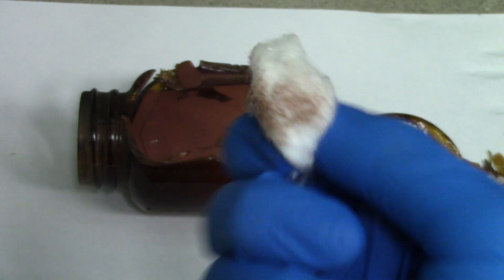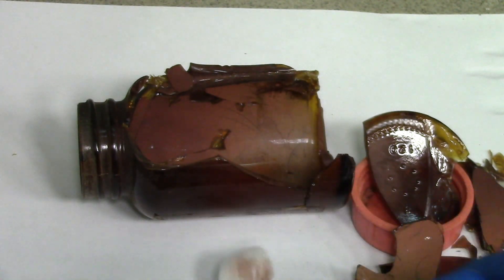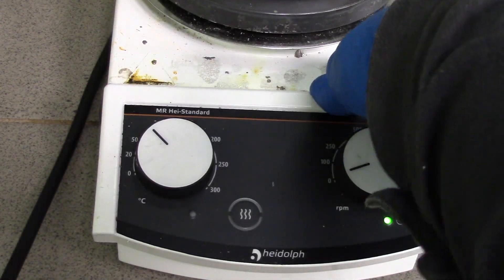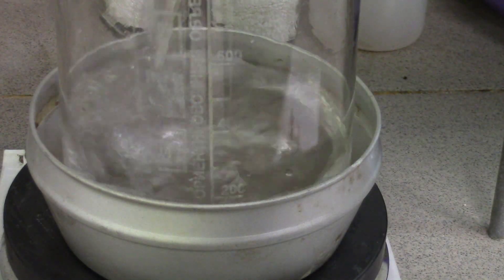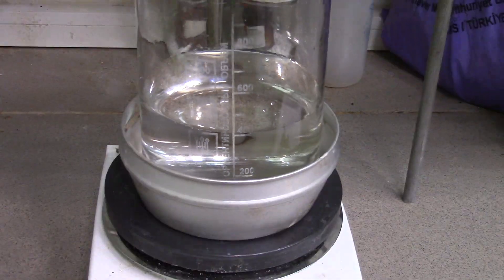In my case I need to wash it off from pieces of broken glass container. For doing this I put a huge beaker onto a hot sand bath for even heating, then poured 400 milliliters of distilled water to cover the whole bunch of initial material.